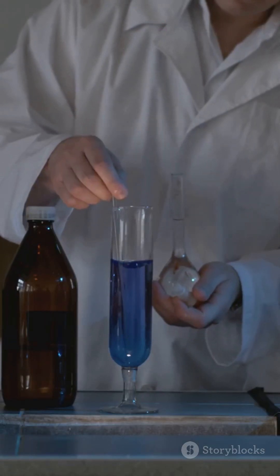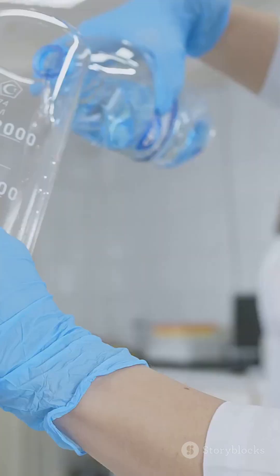Alright students, let's dive into the Jackson Turbidimeter, a nifty gadget for checking water turbidity.